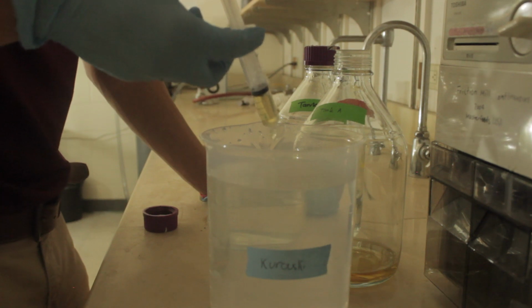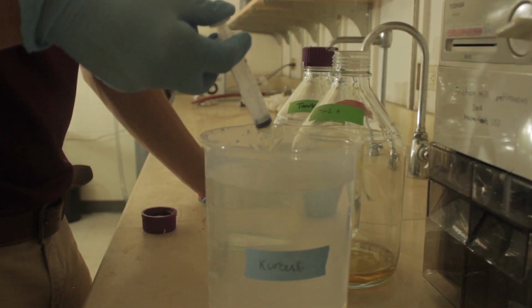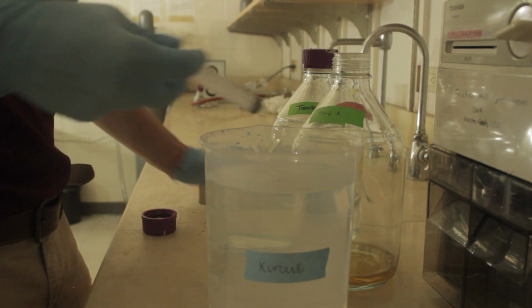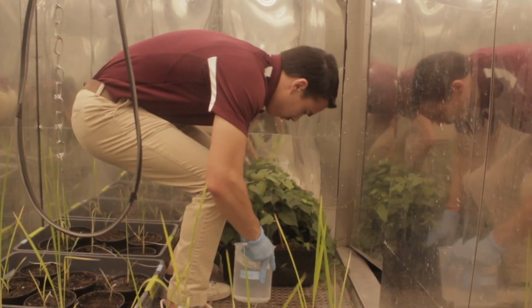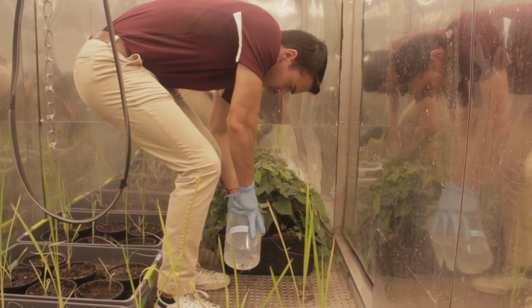Presently, my research revolves around exploring Raman spectroscopy's potential to diagnose arsenic stress in rice crops. Our findings have revealed that Raman spectroscopy can detect toxic levels of arsenic in rice before visible symptoms begin to manifest in the crop. This investigation holds a special significance considering rice's vital role as the staple crop for over half of the world's population.